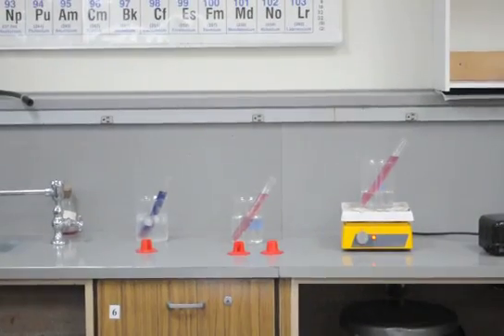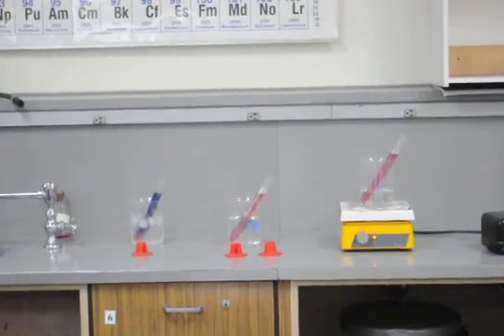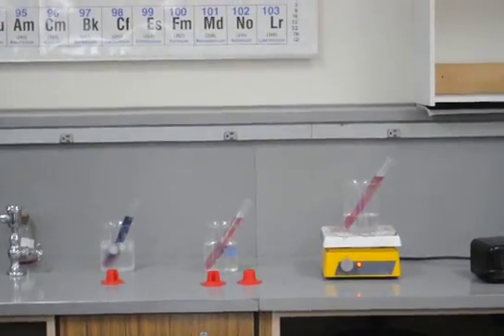All right. And on the right, look what's happening. The color is traveling to the top. Why does it do that?